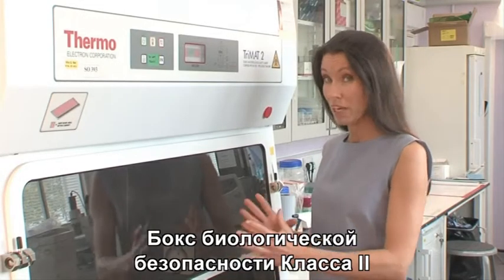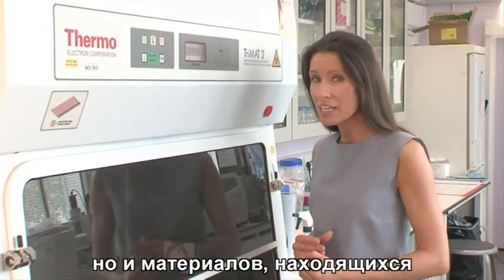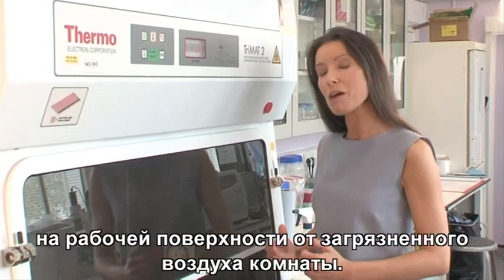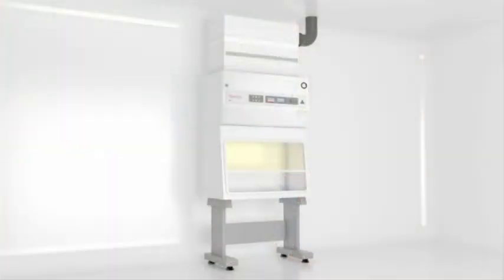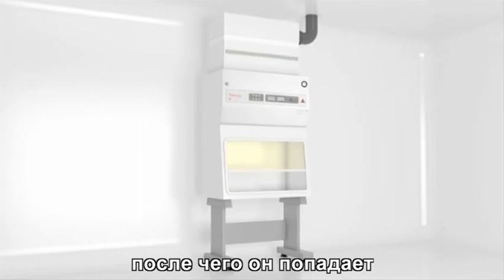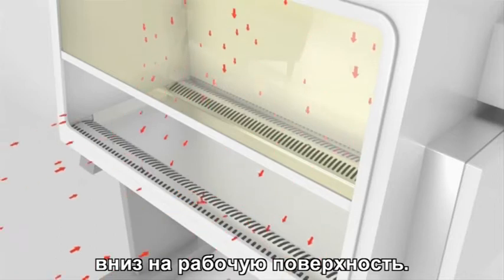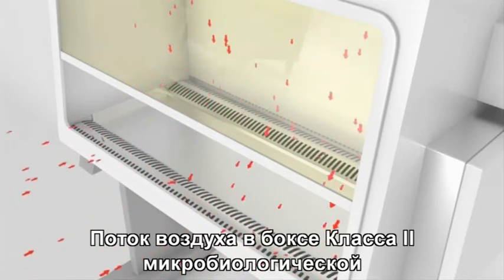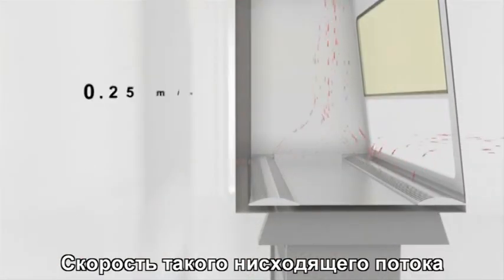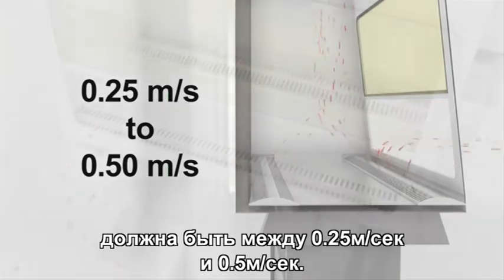The Class 2 biological safety cabinet is designed not only to provide protection for personnel, but also to protect work surface materials from contaminated room air. Class 2 cabinets differ from Class 1 by allowing only air from a HEPA filtered sterile supply to flow over the work surface. Airflow in a Class 2 microbiological safety cabinet is measured as downflow. This downflow rate should be between 0.25 meters per second and 0.5 meters per second.